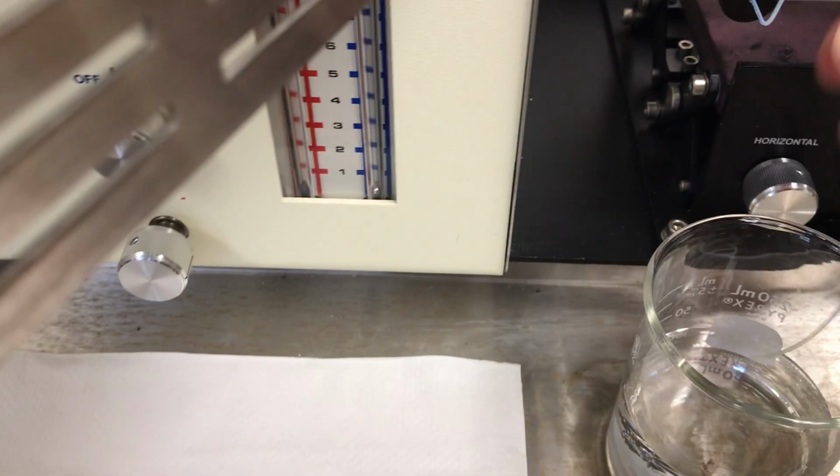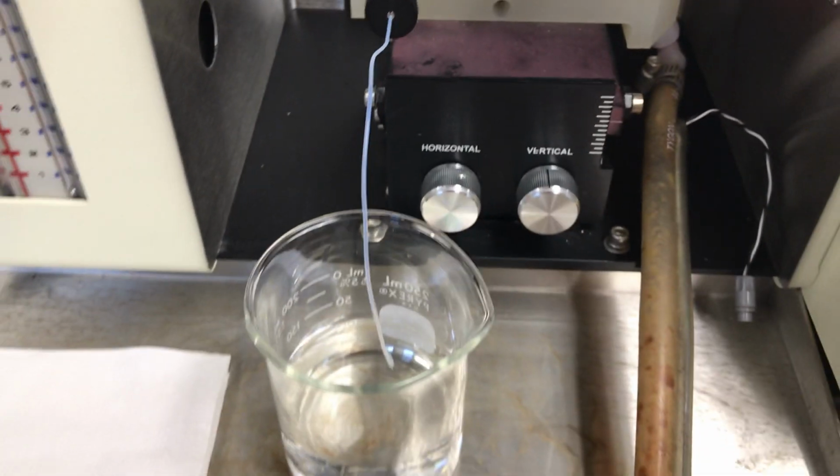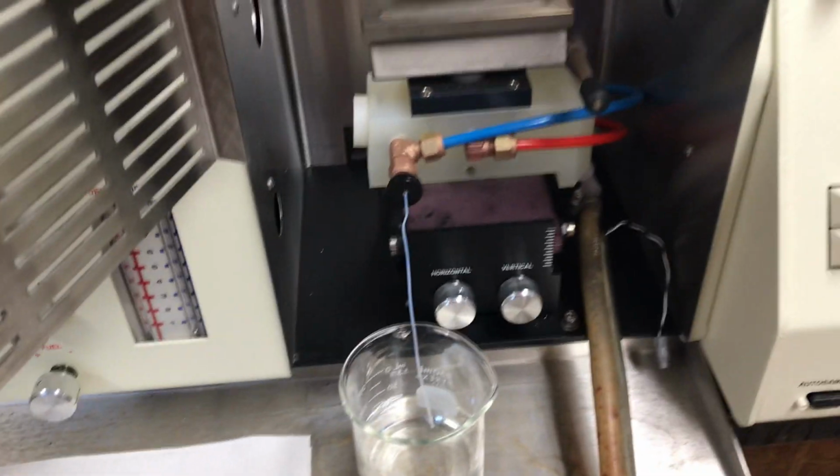Here's the sipper tube, which we'll be using to sip up sample and also distilled water when required. And then we have the drain here, and you'll see that there's a loop down here. And before we ignite the flame, we want to make sure there's liquid in that loop, and indeed there is, so that we don't have a flashback hazard.